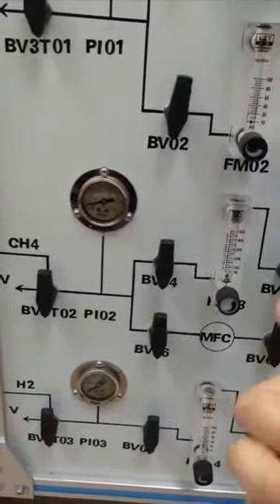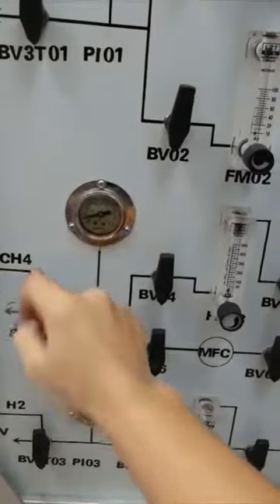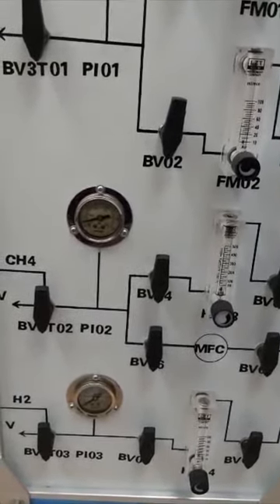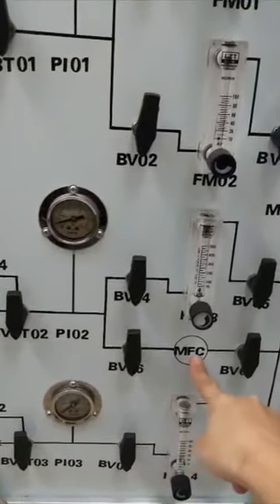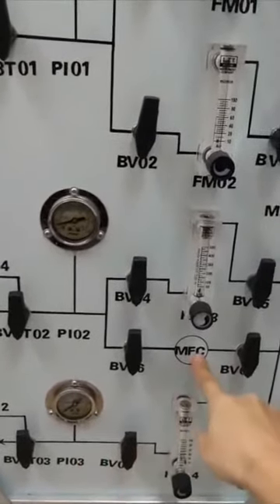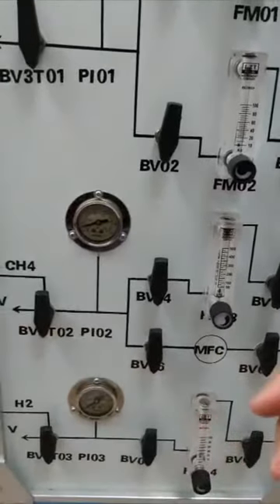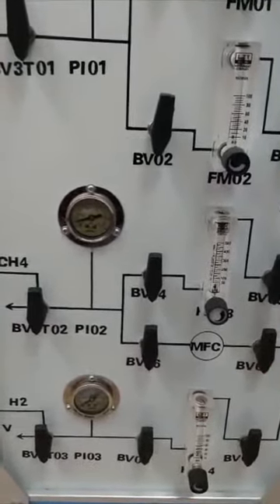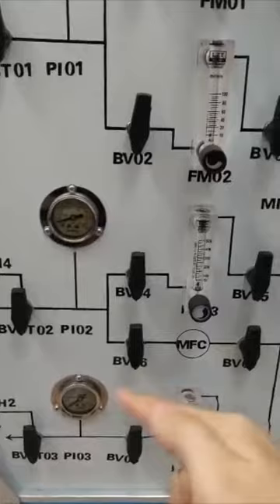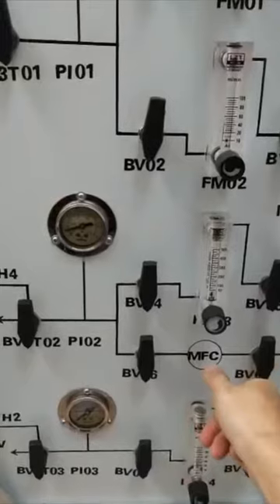In the original design, this system was used for methane reforming, so the methane gas was installed. But at that moment, the methane required high accuracy, so a mass flow controller was installed in the methane line. Unless you are using methane, you should not use this mass flow controller, because it is specifically for methane gas. If you use other gas, the density is different and the thermal property of the gas is also different, so we lose accuracy.